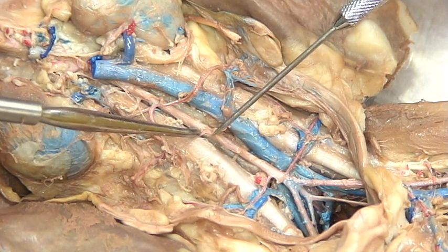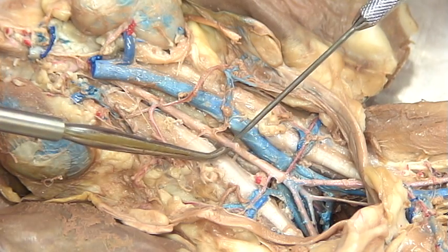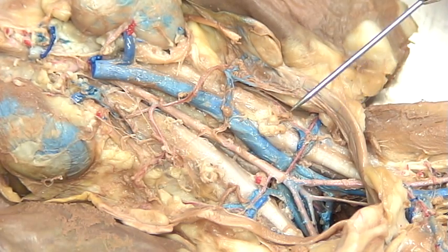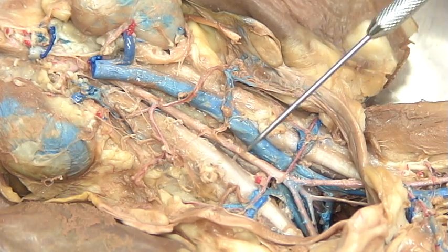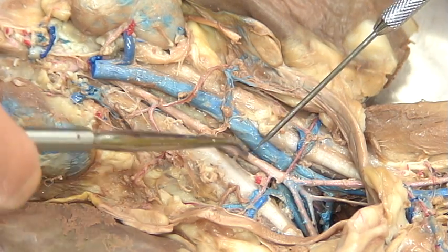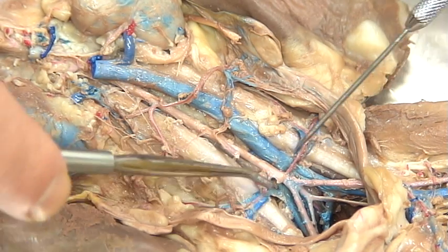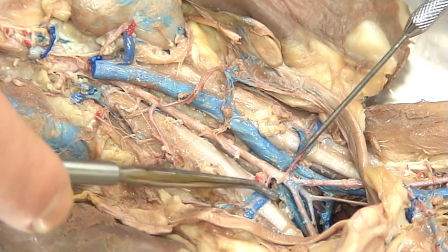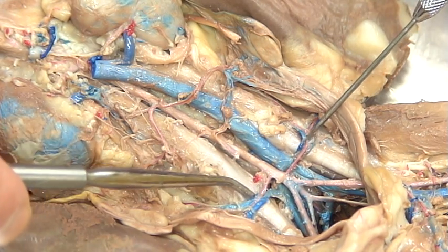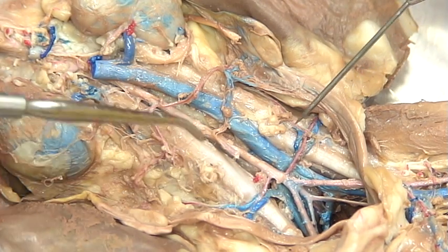Continuing down, we're going to be seeing an inferior mesenteric artery right here, and that's been cut away because we removed the intestines from the cat as well. So this is the inferior mesenteric, and then we find another one of our landmarks. That landmark is going to be right at the crest of the ilium itself. This is the ilial lumbar branch, the ilial lumbar artery.